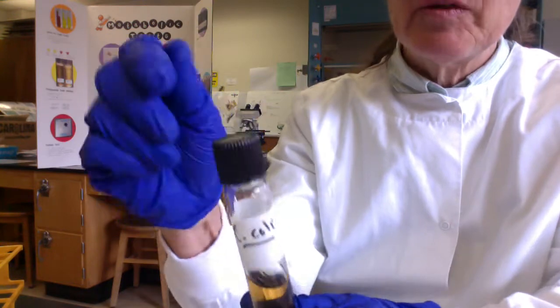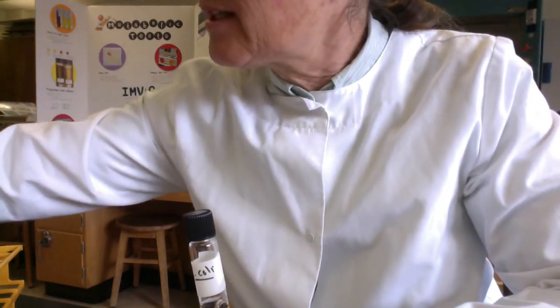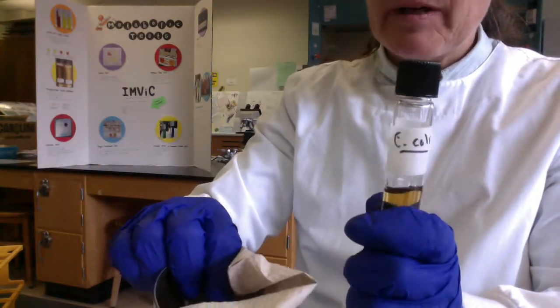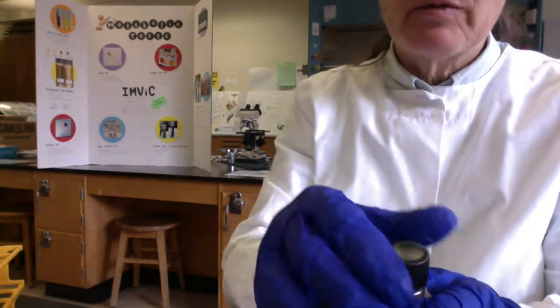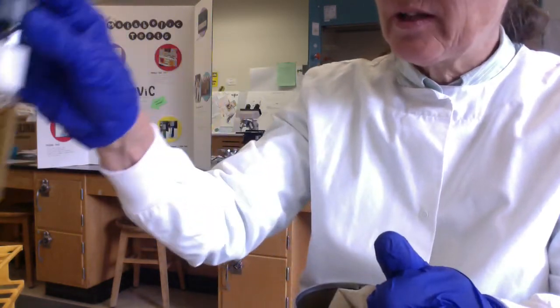Okay. Do you remember, you guys, just again as a safety reminder, these tubes, we placed a paper towel in a can, and we sprayed the paper towel with disinfectant. We incubate our tubes in the cans because we don't have enough room in the incubator for test tubes. And remember, you guys, safety thing, we always barely loosen the cap so they can vent.